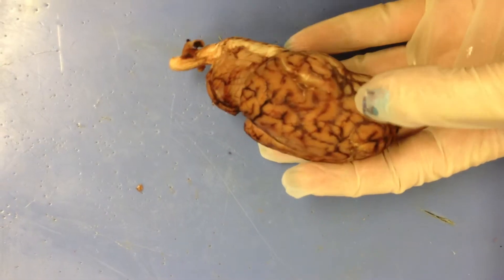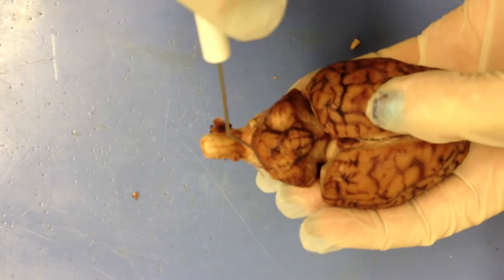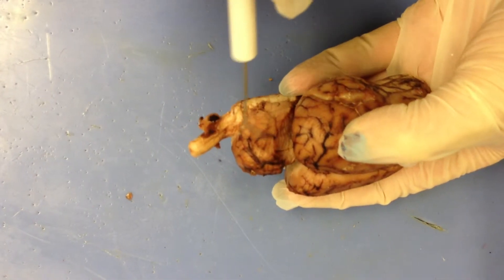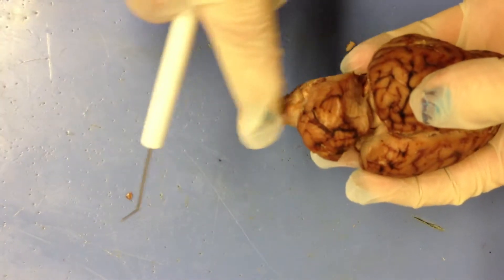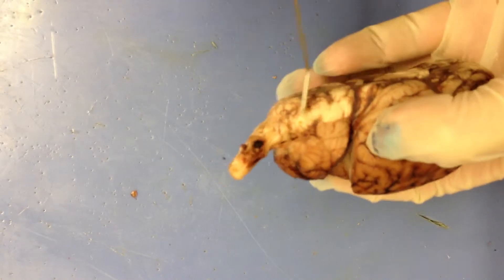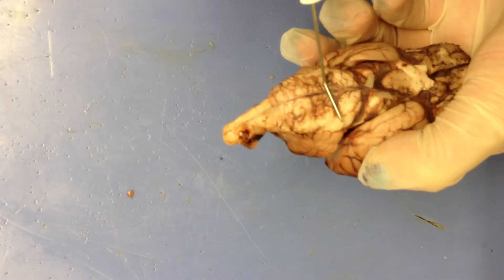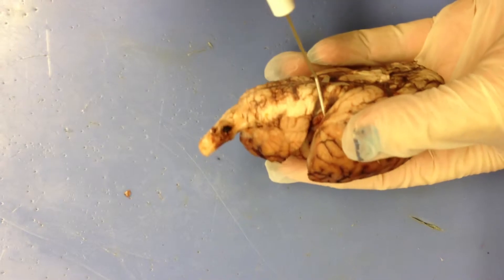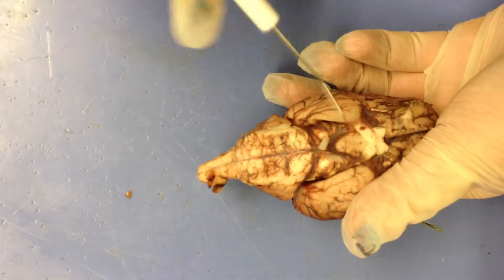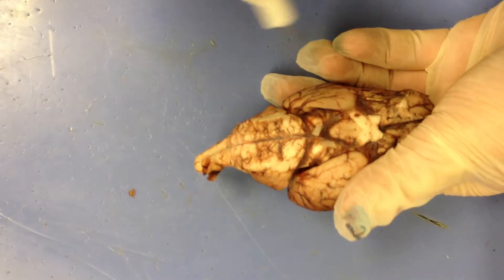We have the cerebellum vermis, which is on top, and the superior lobes of the cerebellum right here. The spinal cord. The medulla. The olives. Pons. The cerebral peduncles.